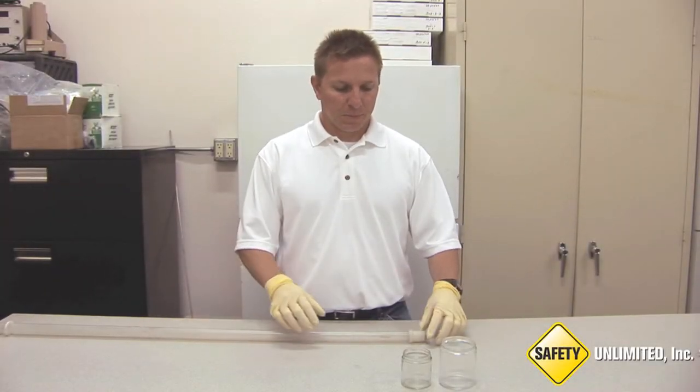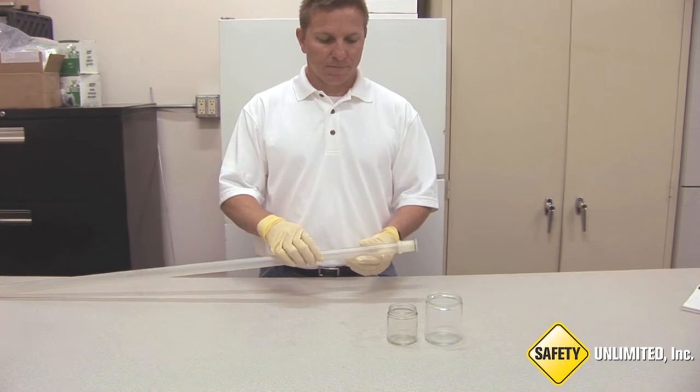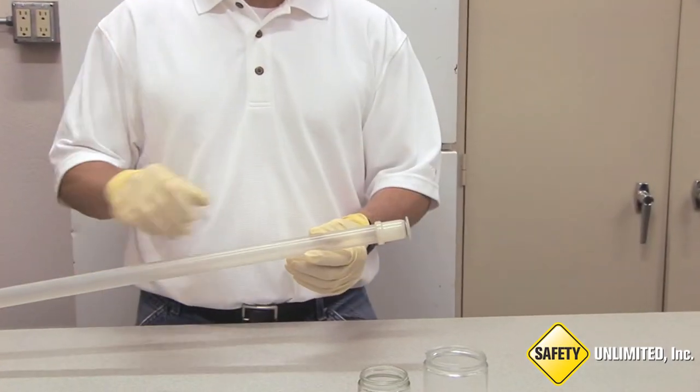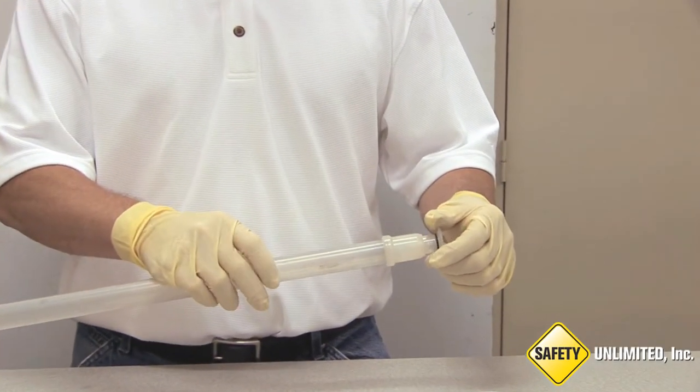This is an example of a drum thief. As the name implies, drum thieves are intended to take samples from a drum.